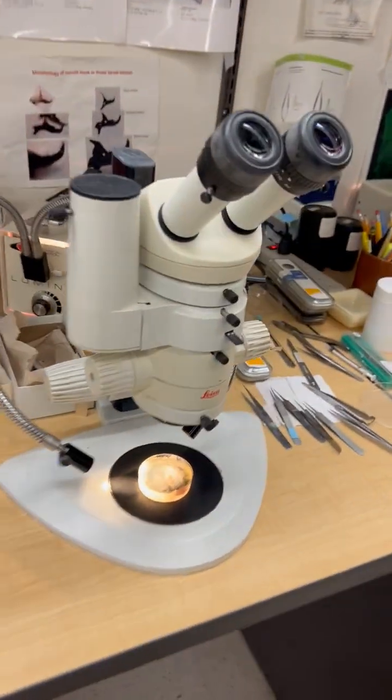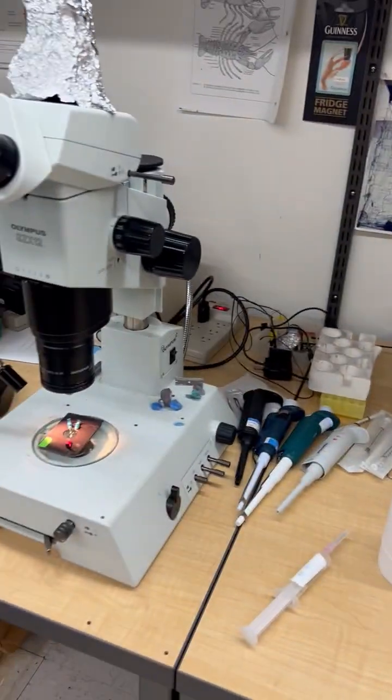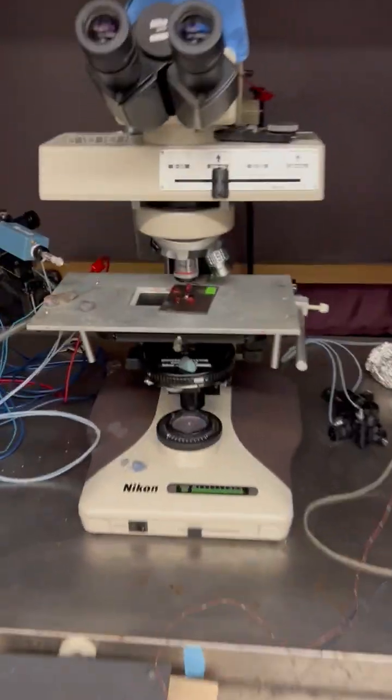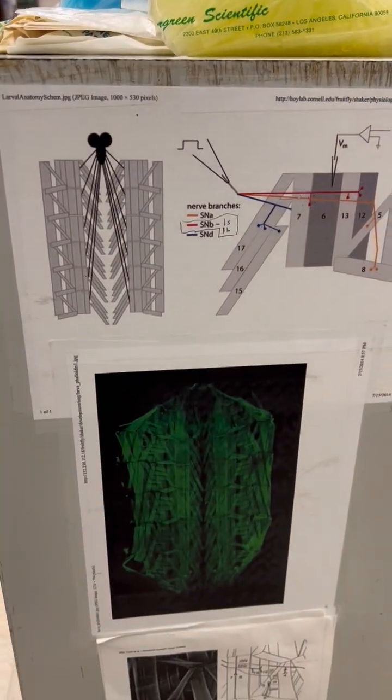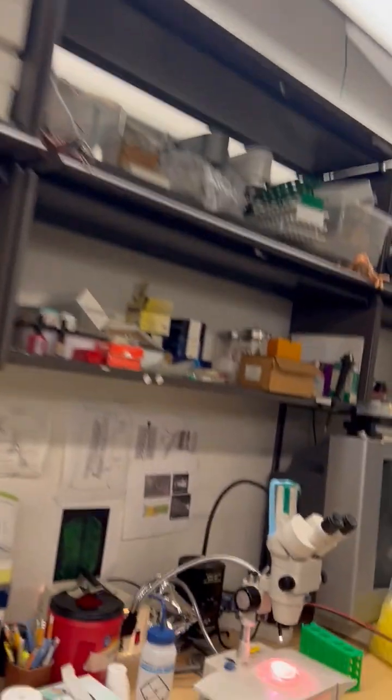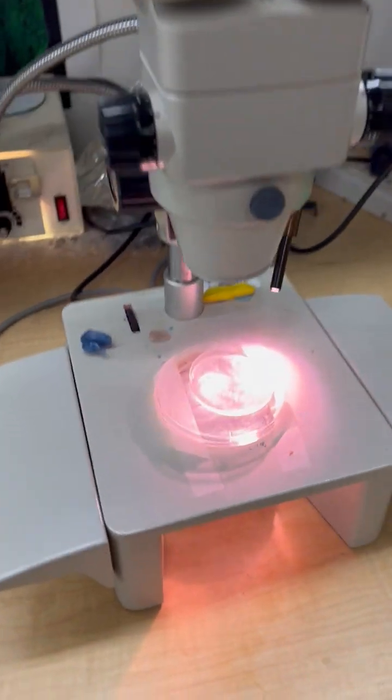And then we showed not only that about the heart rate in Drosophila, but then we had another prep over here where they could look at the neuromuscular junction of Drosophila, and you can kind of see it through the microscope there, and how you stimulate the nerve and record from identified muscles in a Drosophila larvae to look at synaptic transmission.